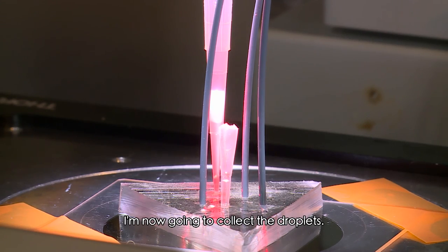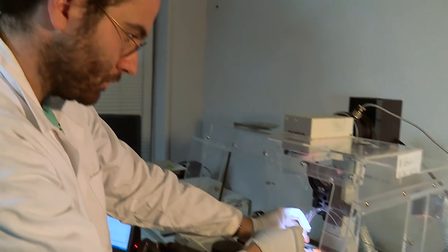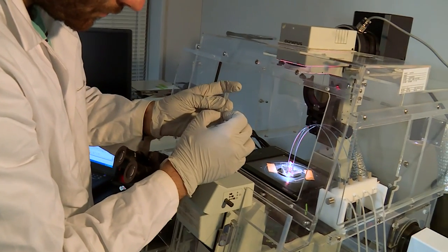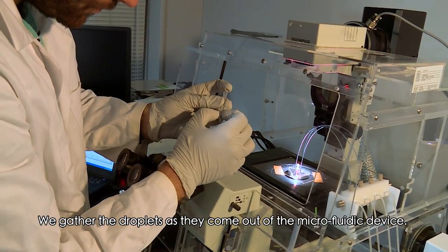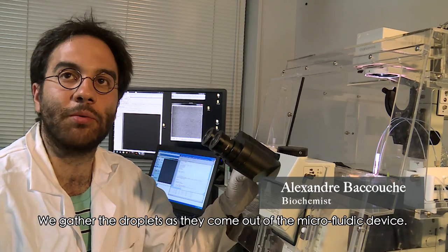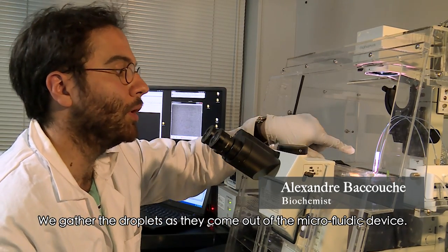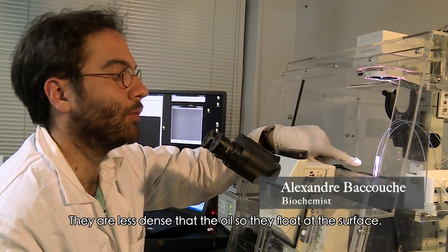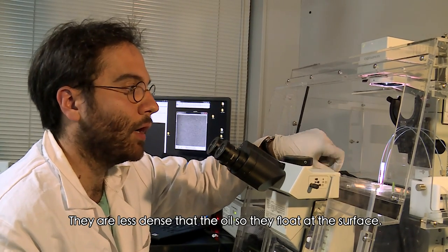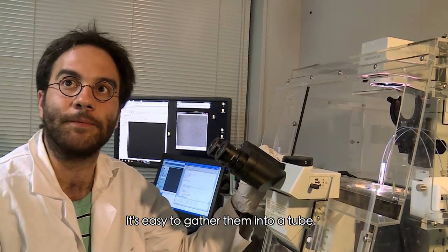Now I'm going to collect the droplets out of the microfluidics. As long as they are less dense than the oil, they will float to the surface and we will collect them in a plastic tube.